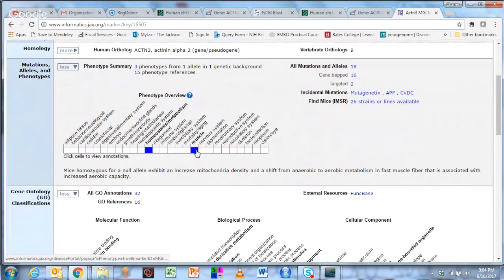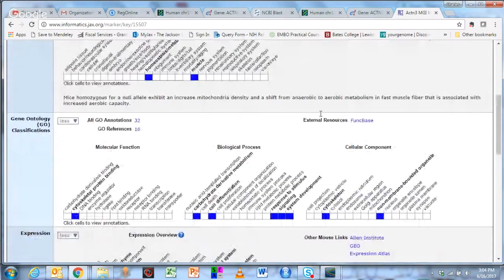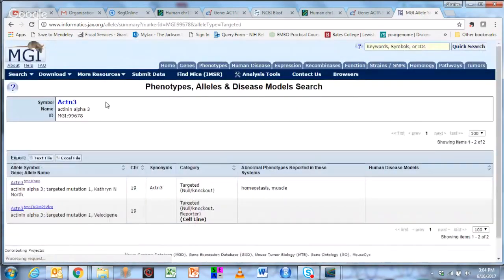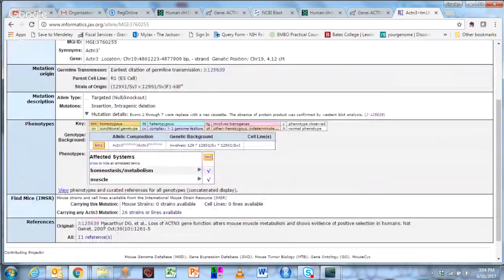It's involved in homeostasis and muscle physiology. It also tells you that there's actually been some work on making alleles, either trapped or mutations. So there are mutations in the mouse example too. Rather than go through all of the mouse database, I'm going to go to these two targeted or knockout genes. And you can see that this gene has been targeted and knocked out twice, once in a cell line and once in a mouse. And if I hit this, it'll take me to their gene report. So this team, MacArthur et al., knocked this gene out.